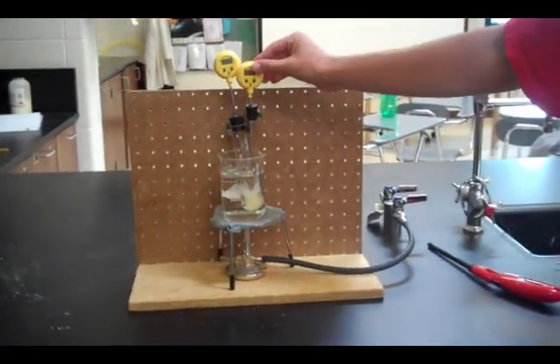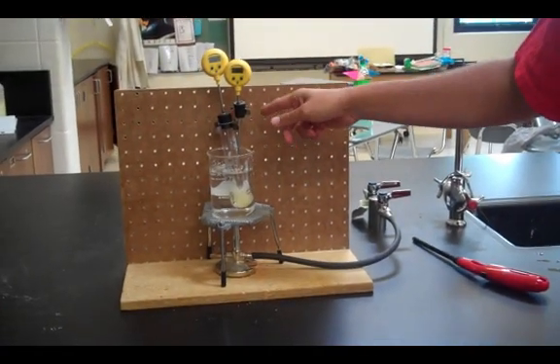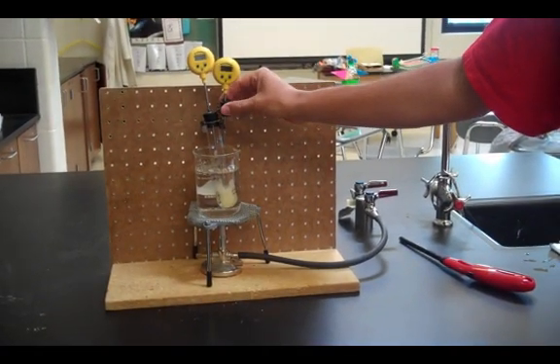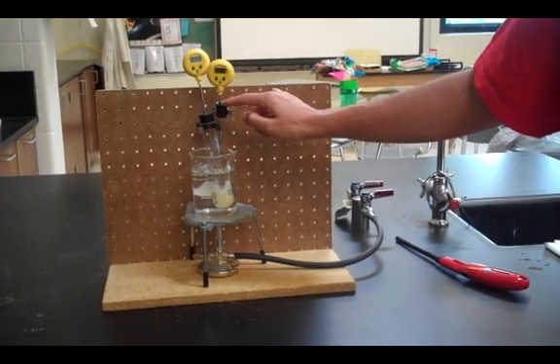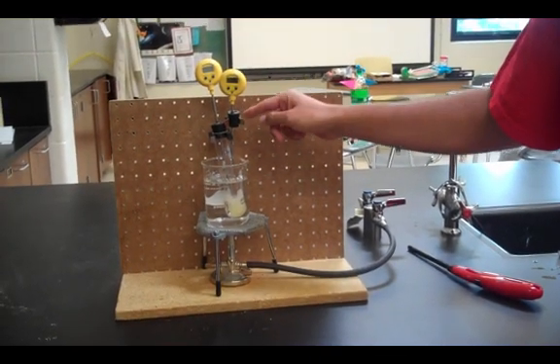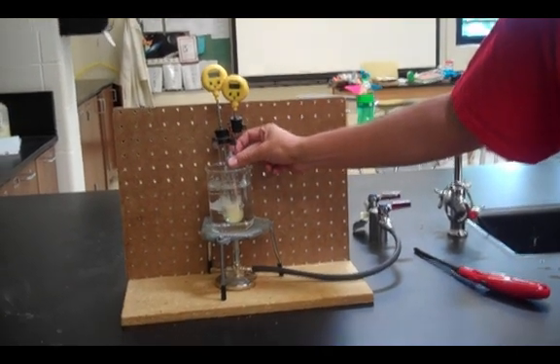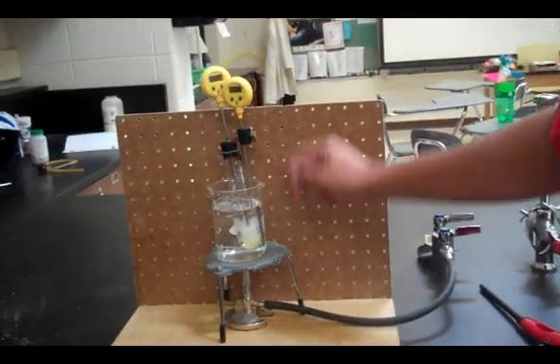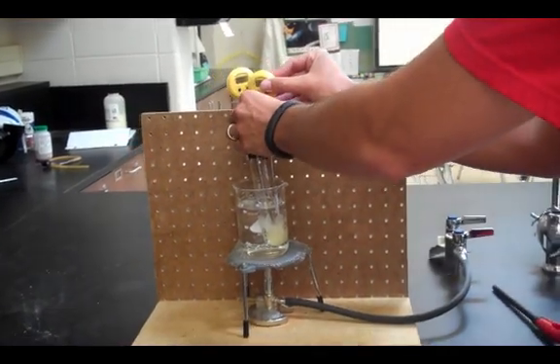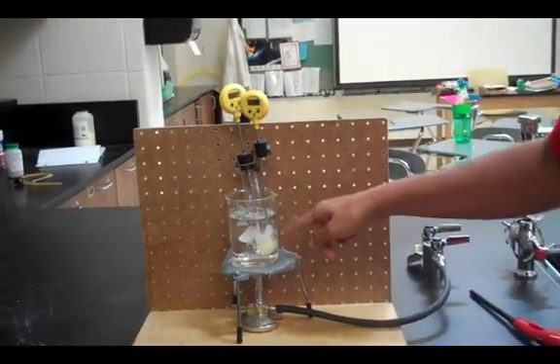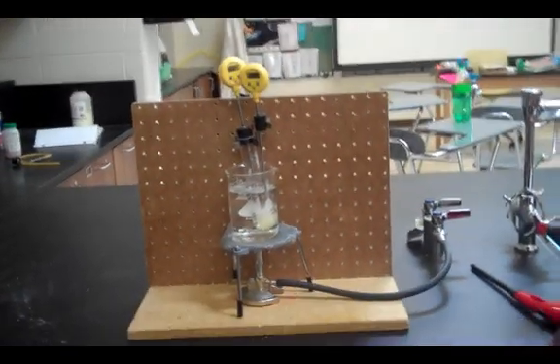Next you'll need a second thermometer. This one is in a small rubber stopper, also with two holes in the white sleeve, so that it fits in a small clamp. And now that one is actually measuring the temperature of the water. You want to try and adjust that rubber o-ring so the thermometer is not touching the sides or the bottom of the beaker.